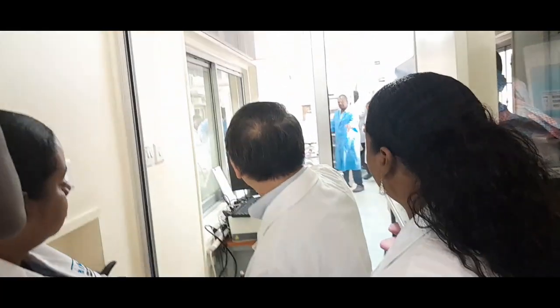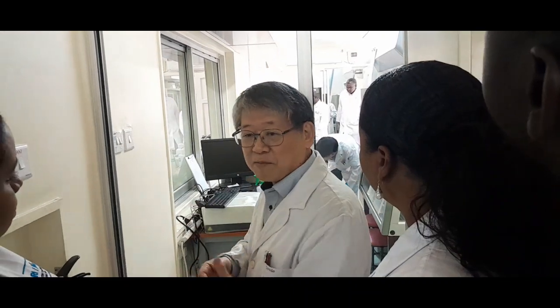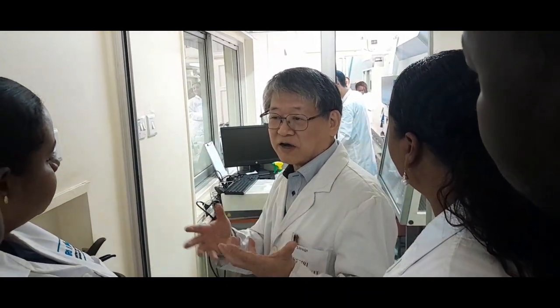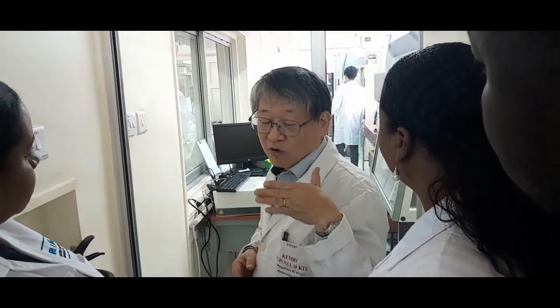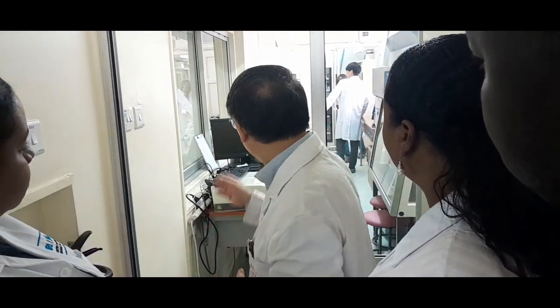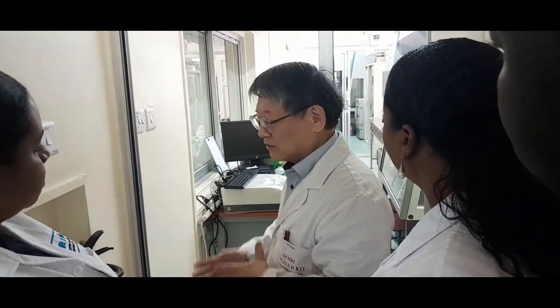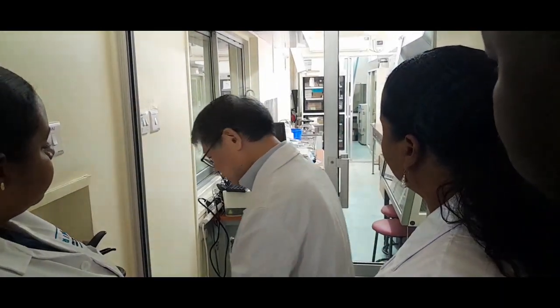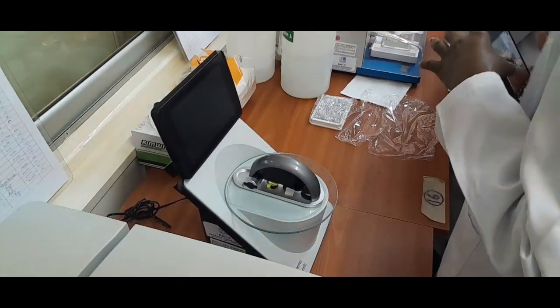And also the end of that laboratory has an emergency exit. So in case of fire or something happening at the entrance side, you cannot go out from that side. In that case, you can still go out from this side, so that you can safely evacuate.